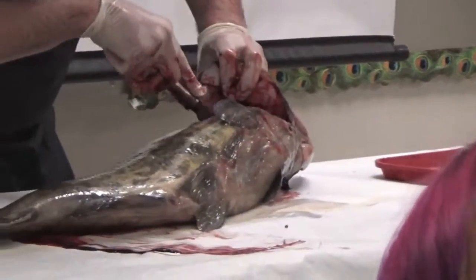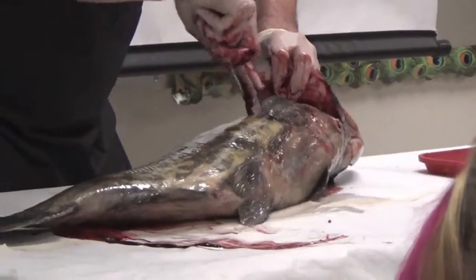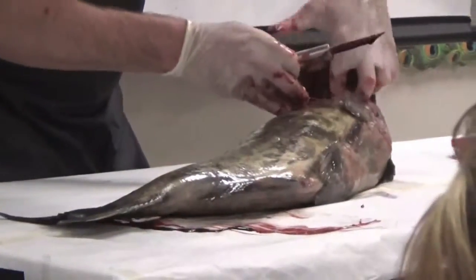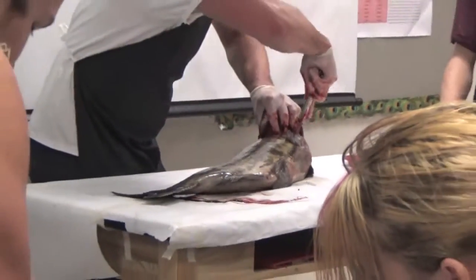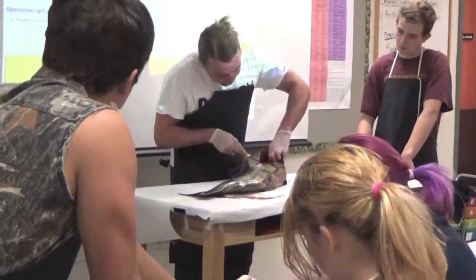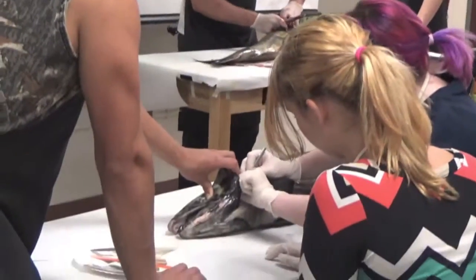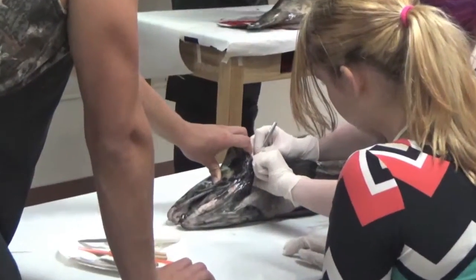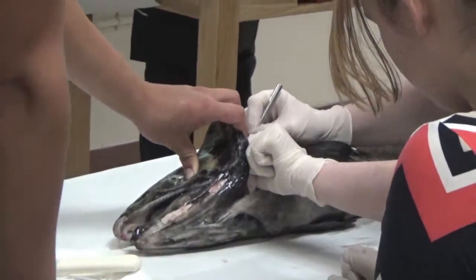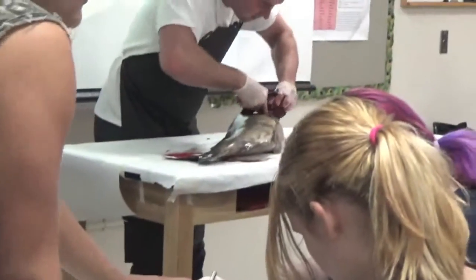You've got to cut the gills out without cutting your fingers. The way I like to do it is going in actually where it starts, and then you're going to need to cut around it at the base, so that you can actually pull it out. There are connections at the front of the gills as well as the very back.